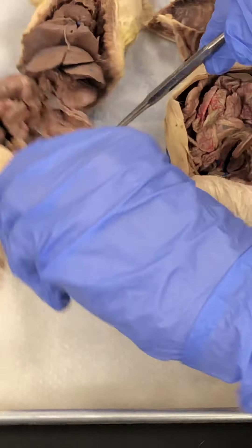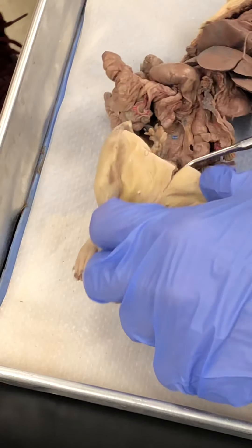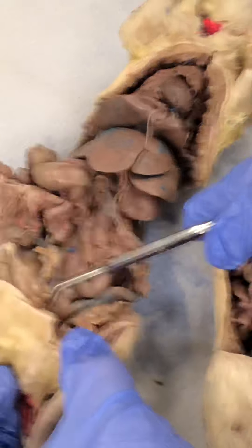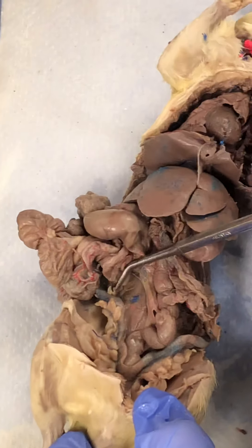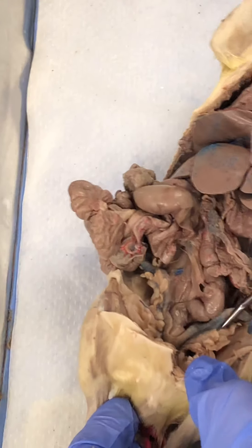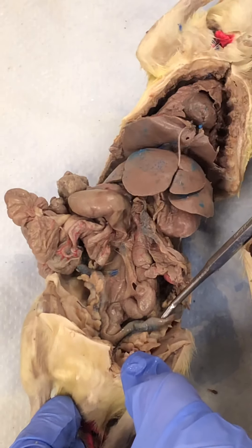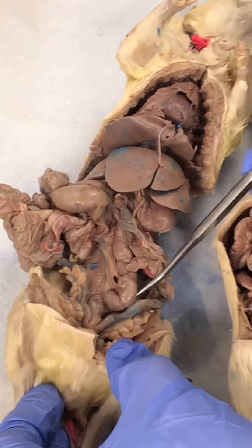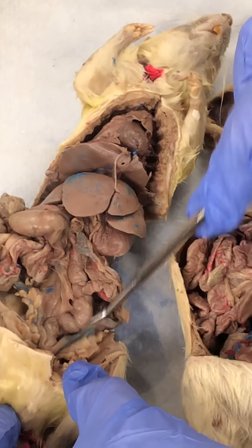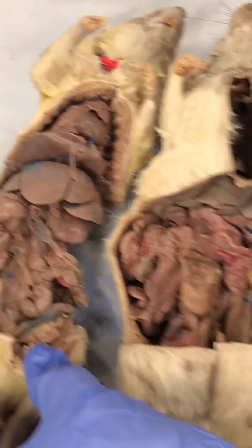In the female, all you have to know is the uterus. It has a common spot right there and goes up one side and then up the other side. The one on the test is not blue, so don't let the blue color throw you.